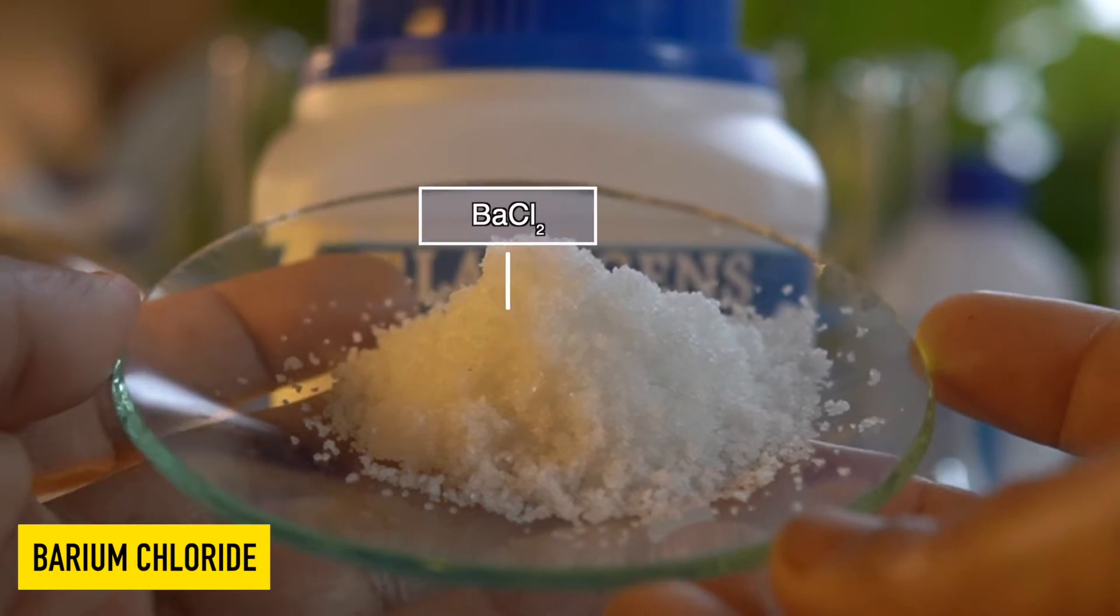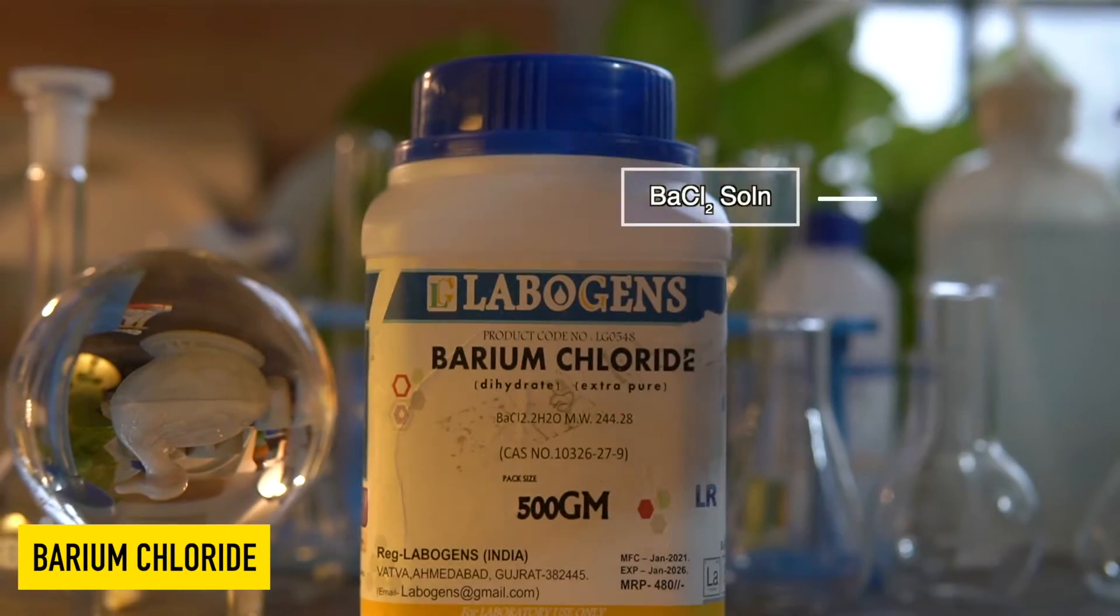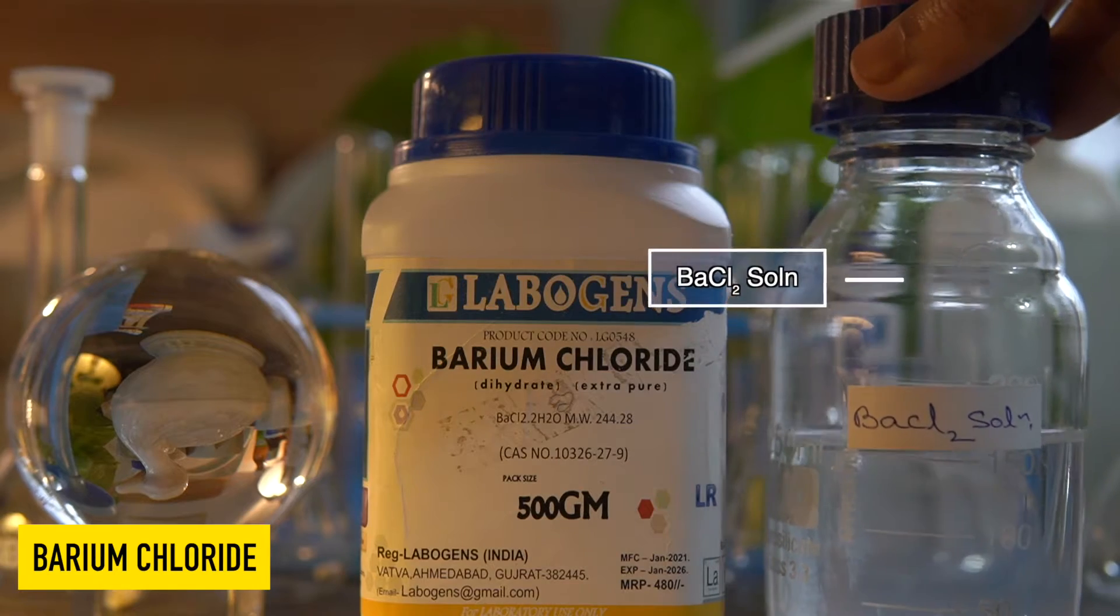This is barium chloride, a white color hygroscopic substance, highly soluble in water.